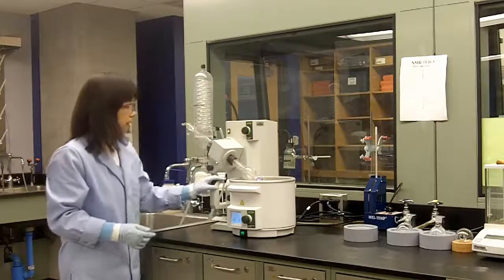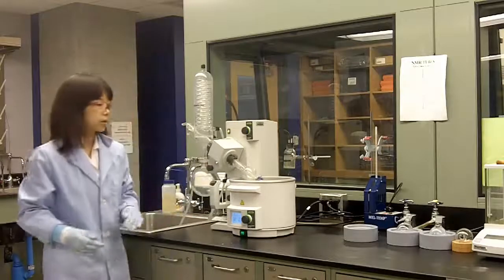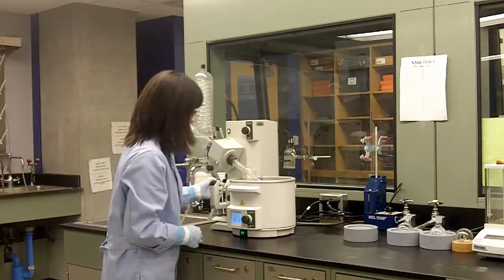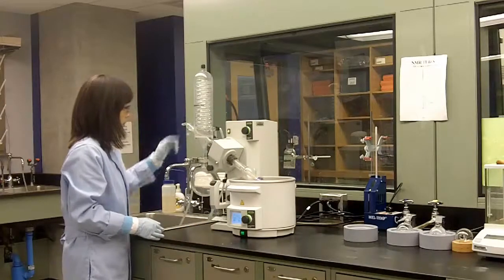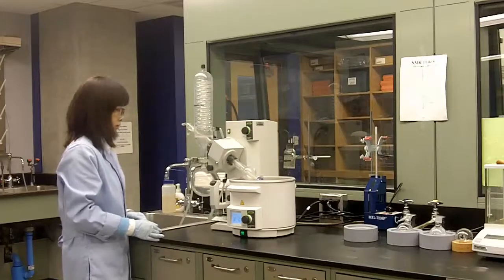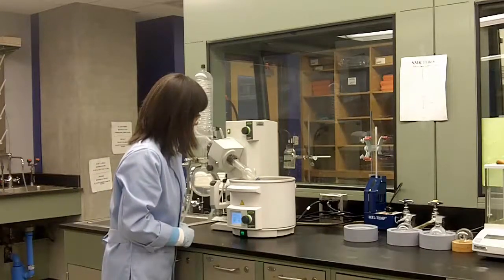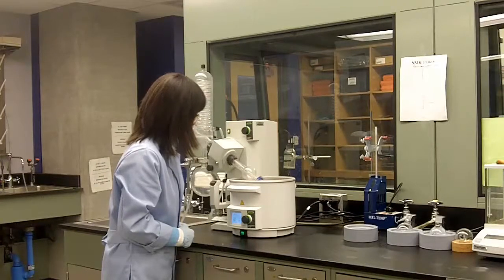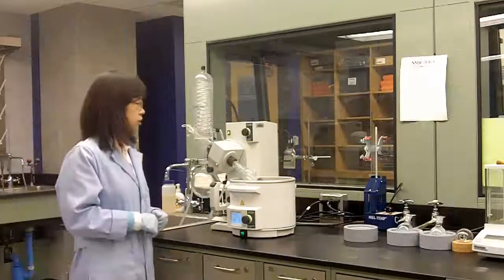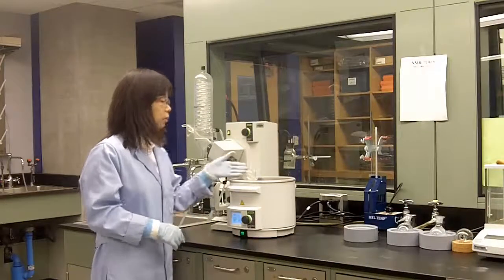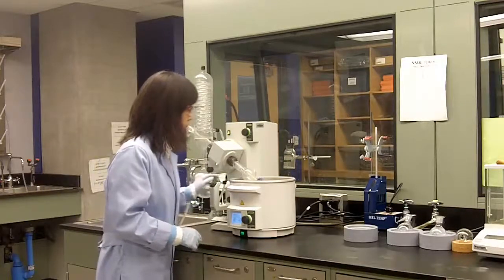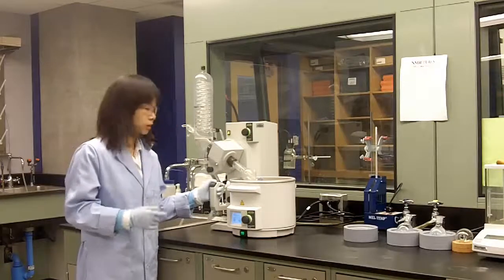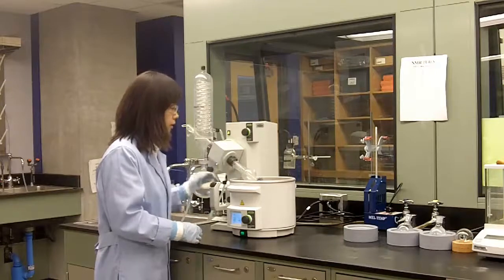This warm water bath will provide heat and speed up evaporation. As the solvent gradually disappears, your compound will come out either as white solids or as an oil. In this case, we have biphenol in the flask as white solid. You can see the solvent is gradually disappearing.